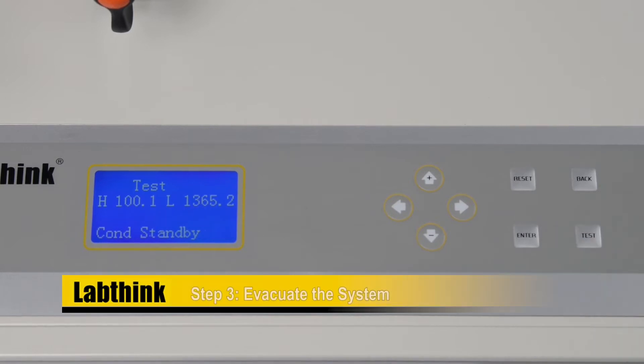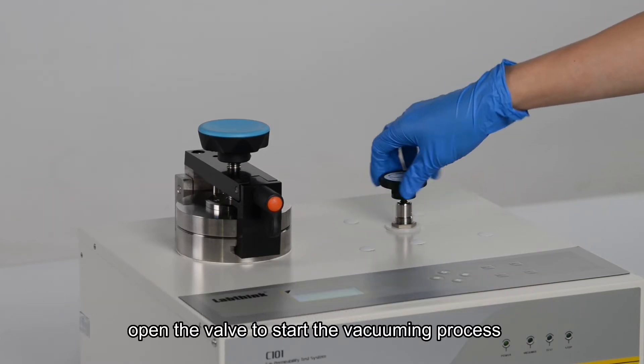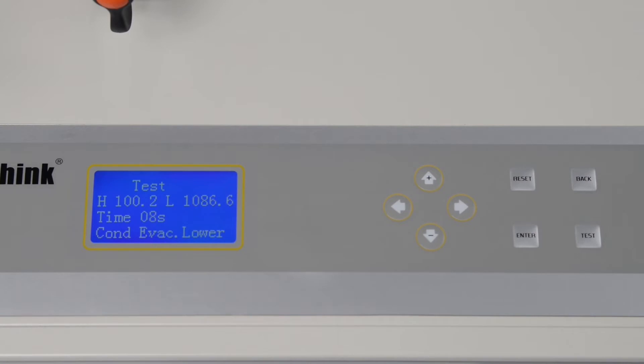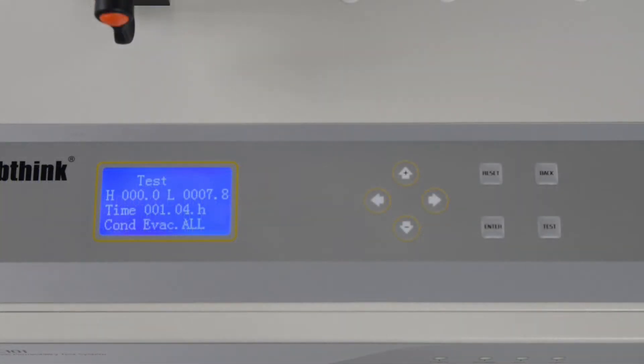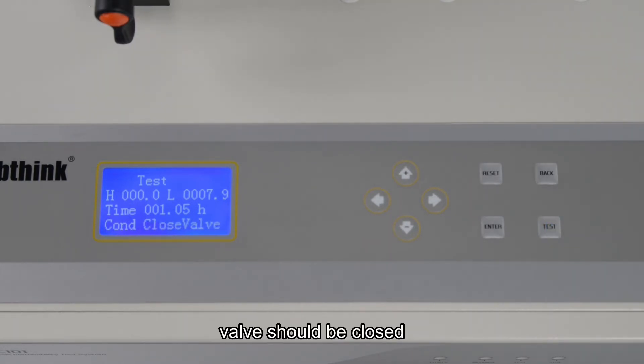Step 3: Evacuate the system. First, open the valve to start the vacuuming process. When the vacuum degree is reached, the valve should be closed.